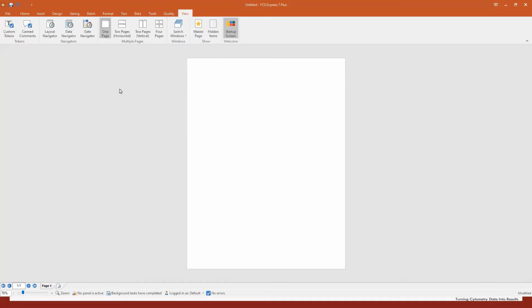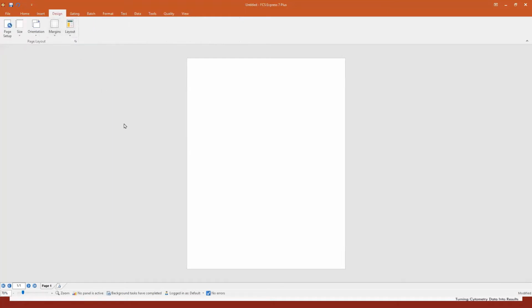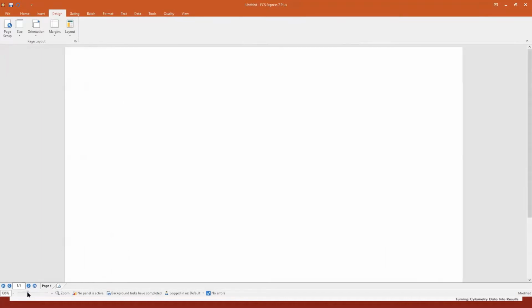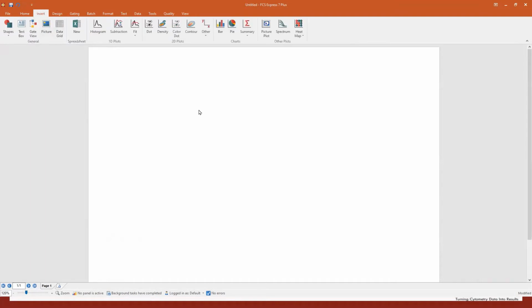This is my page. You already know the design tab. So if you want to change the orientation or the margin or the size, just go here, and for example, switch to landscape. We also have a zoom at the bottom left. You see here, I can zoom in and zoom out. So just to get you started, I will insert a text box. Click on text box, draw it as you would do in PowerPoint. So there is nothing to be scared of.